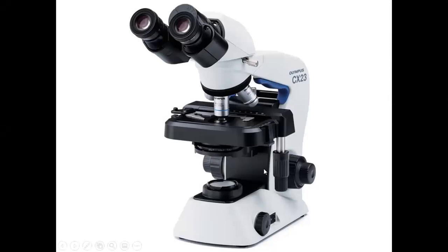This is in the actual class that I teach. This is the microscope that we use. And I put this unlabeled picture here for you to reference. I go back and reference it, because later on in this presentation, you're going to see a picture of the microscope with arrows and names all over it. And it's going to be hard to see some of these actual parts once they've been pointed out in the images. So I just wanted you to have this to reference. You can go back and look at it after we talk about it.